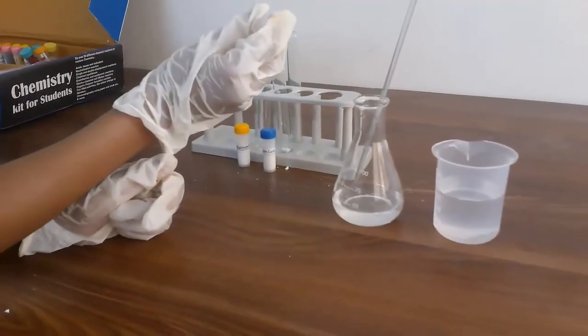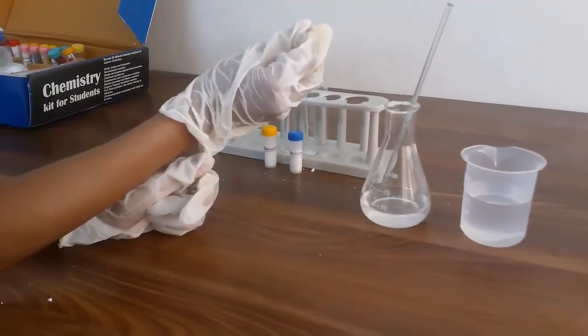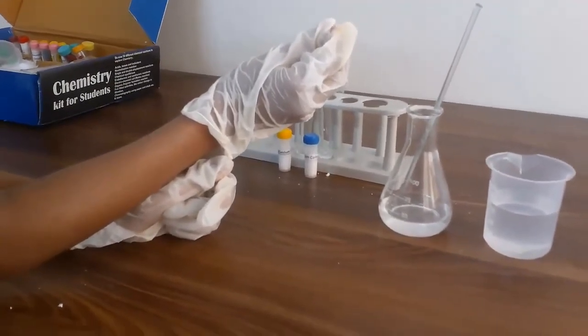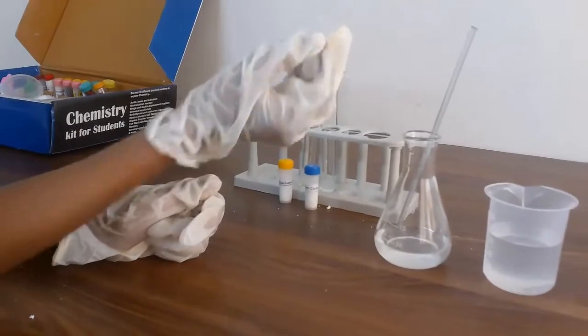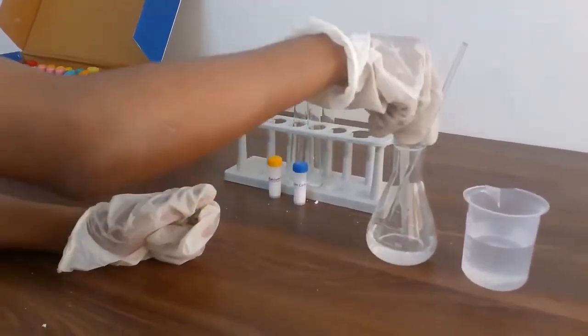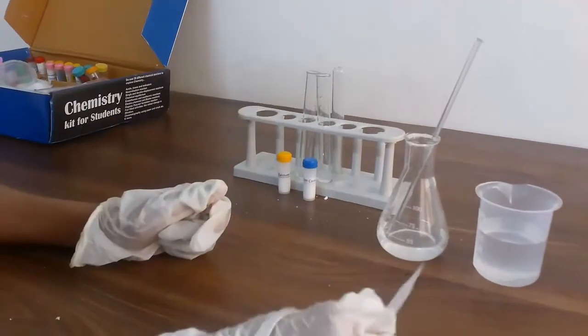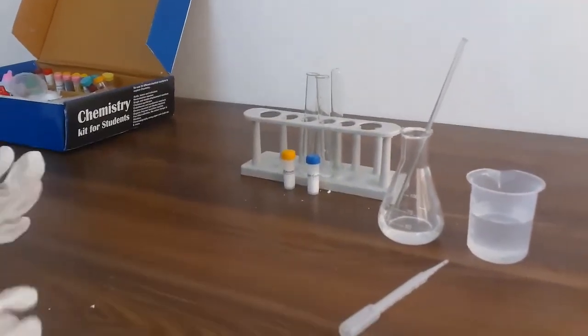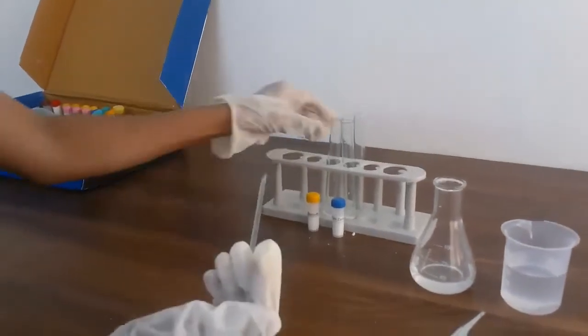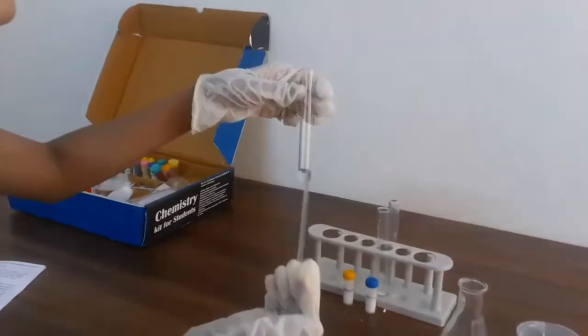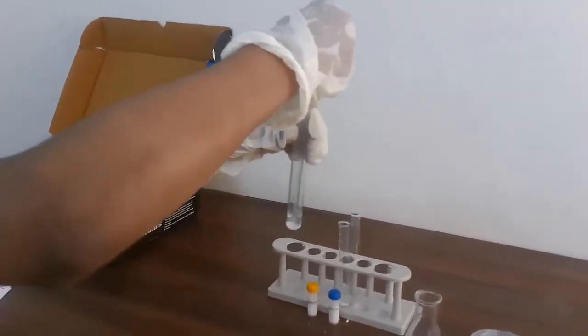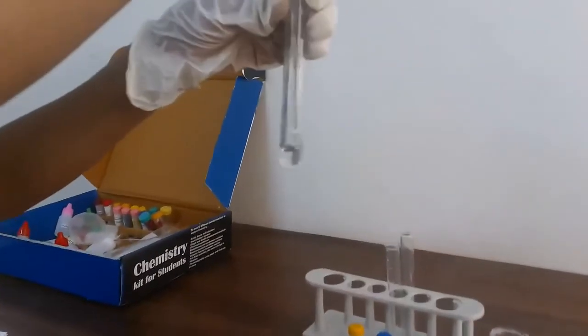Now I'm going to take a little bit more water as my water got finished. I'll add 25 drops to the second test tube. Now just wash your pasteur pipette and put that down. Now just mix both of these test tubes and make sure that the chemicals dissolve.